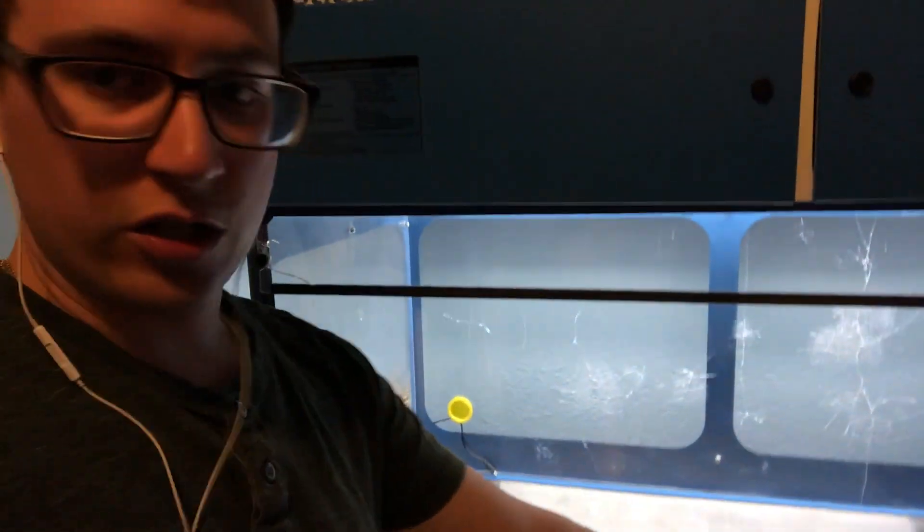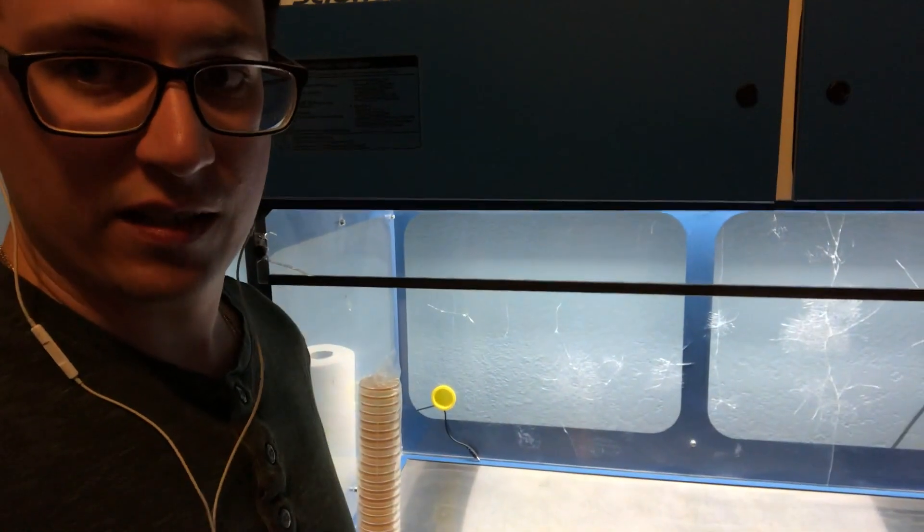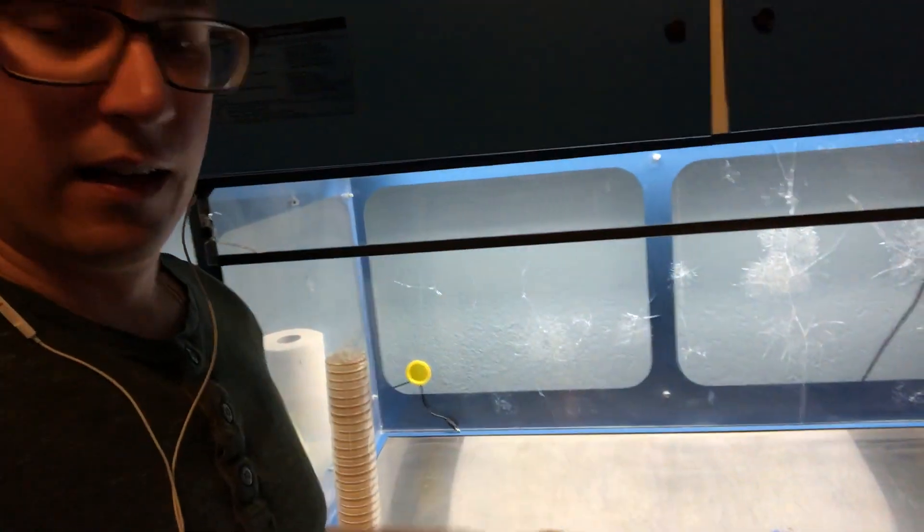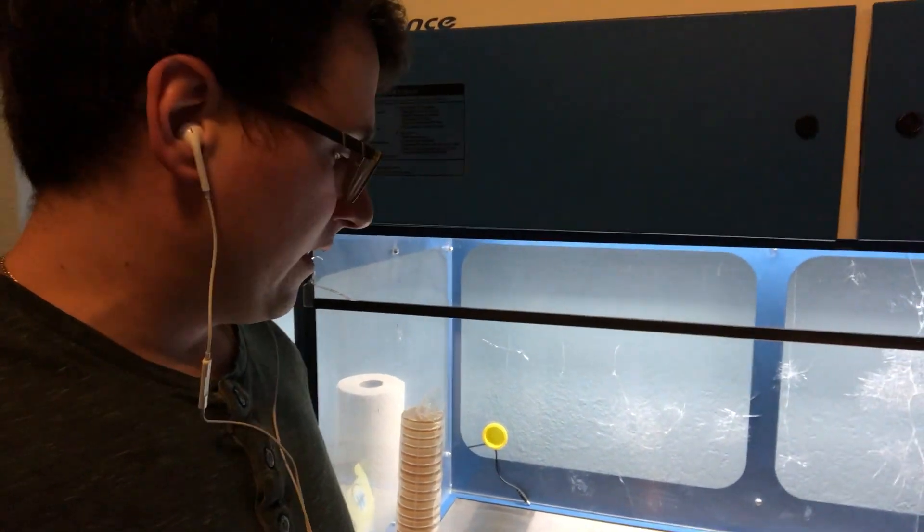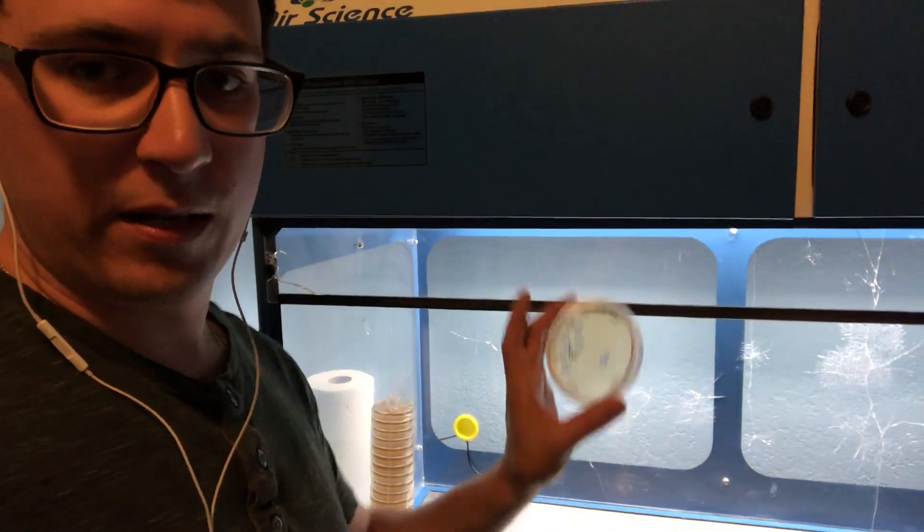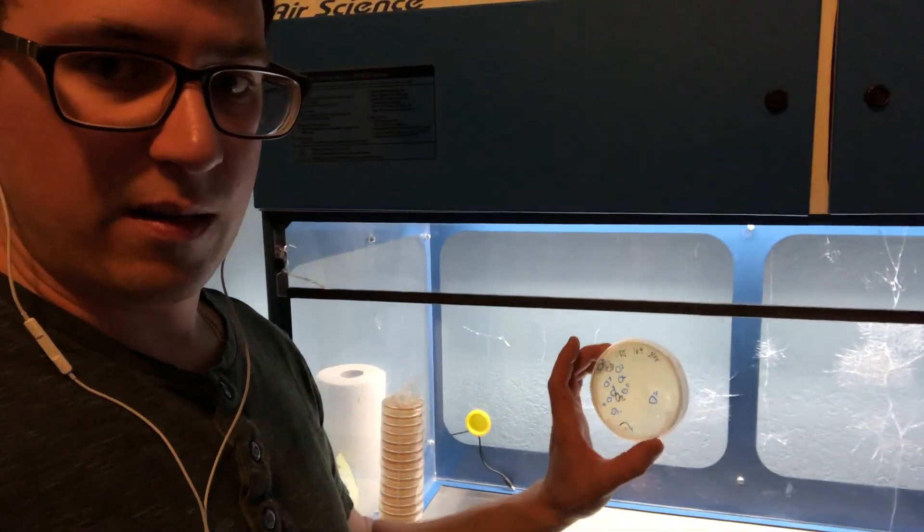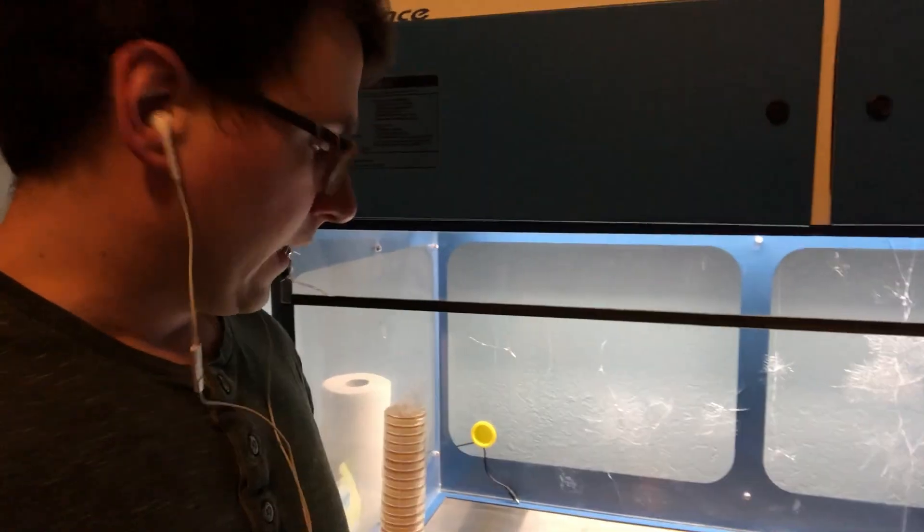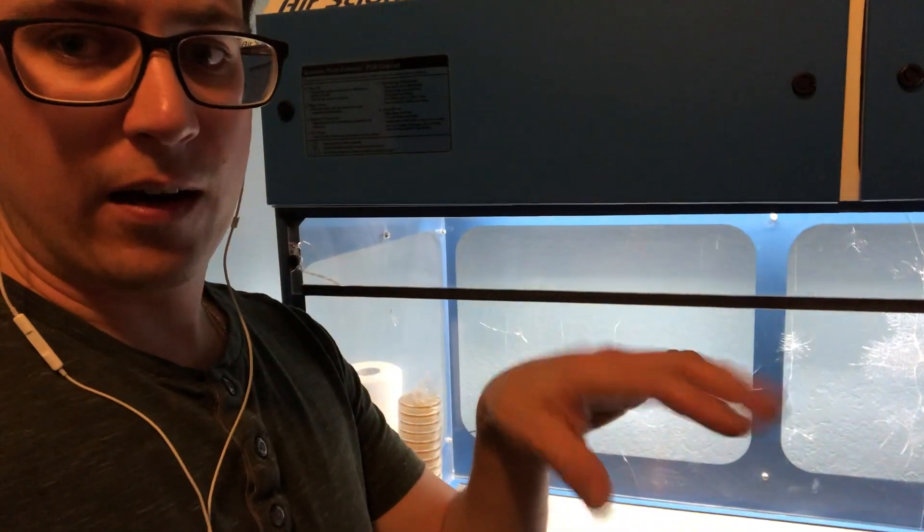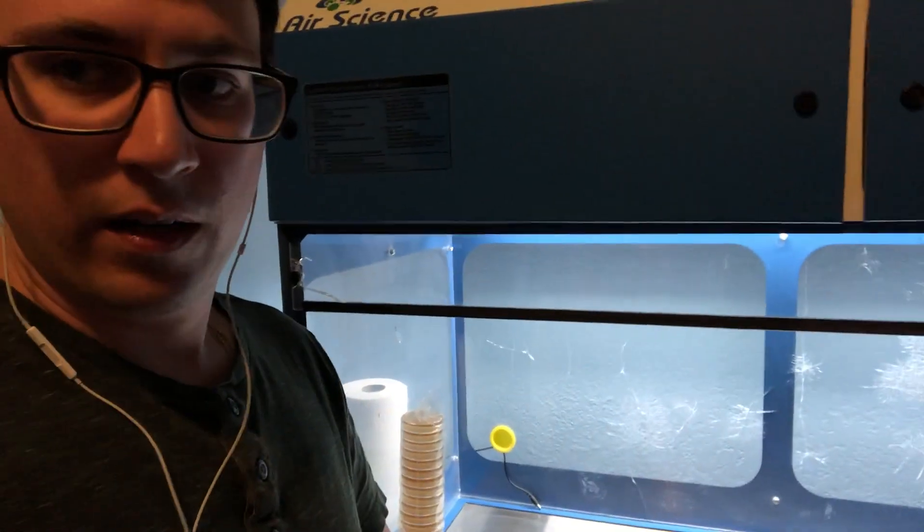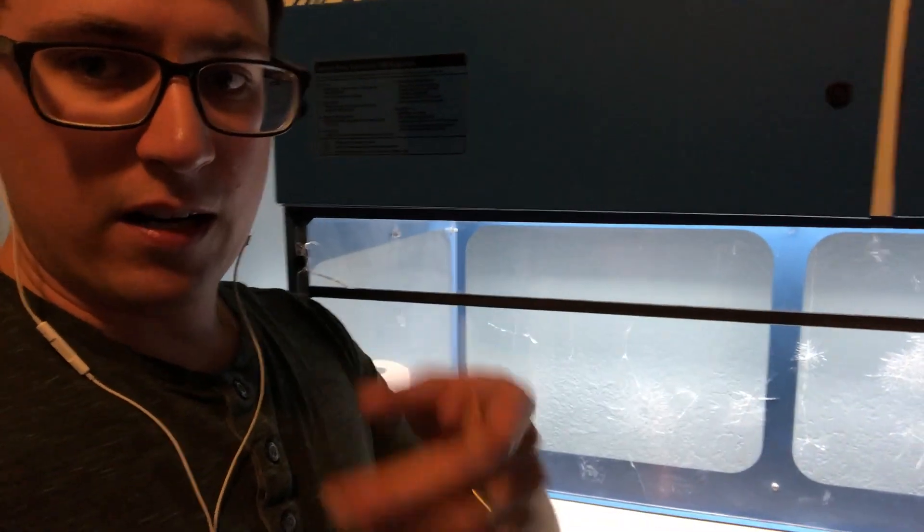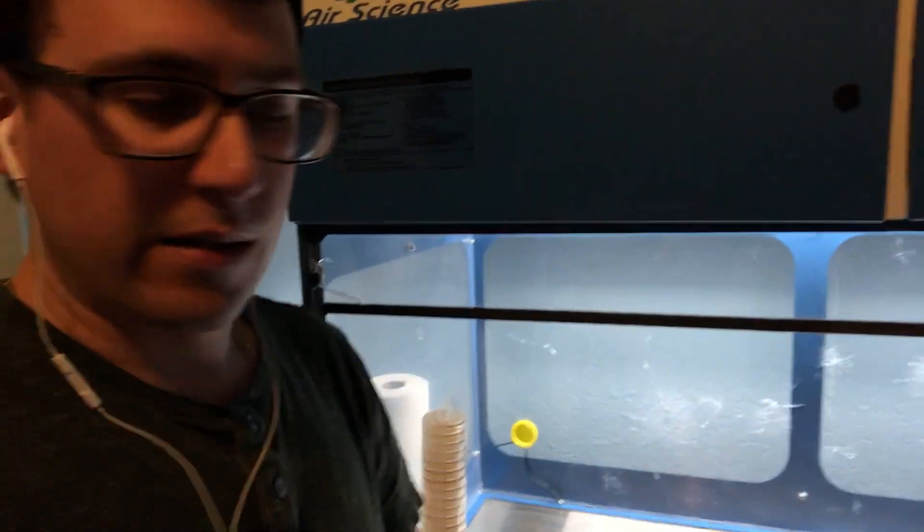I'll show you one of each and I've got a lot of isolates to do so I'm going to go ahead and start getting ahead on all of my isolates. And I'll just show you the pink oyster because that is what we have the most of and they seem to be doing the best. So I'll go ahead and flip this camera around and I'll do like a first person view and at the very end I wanted to go over my incubator, someone asked about that.